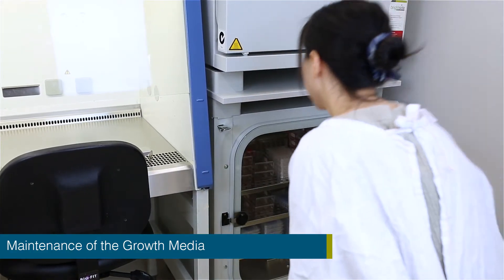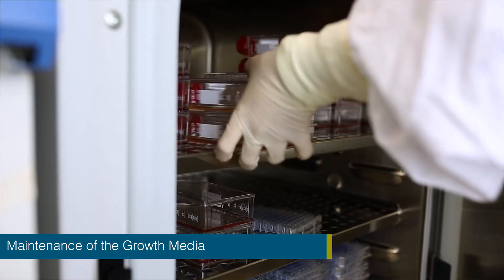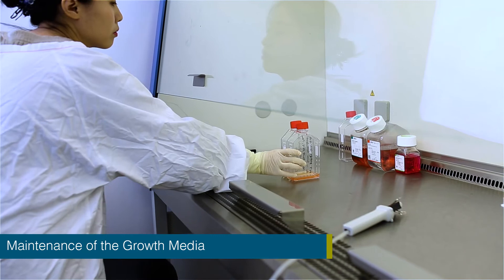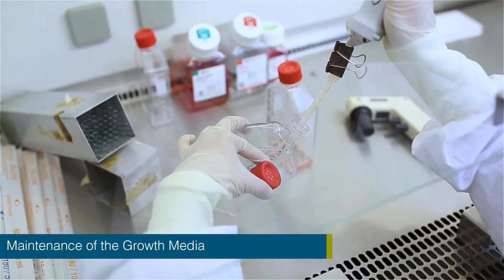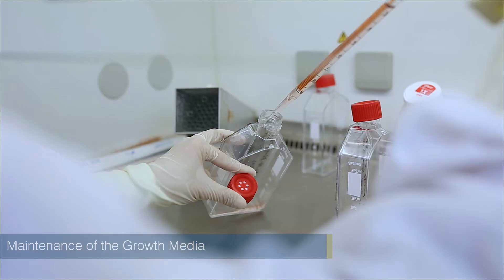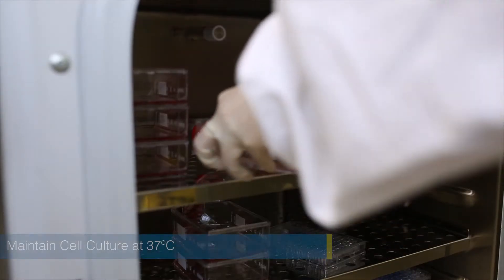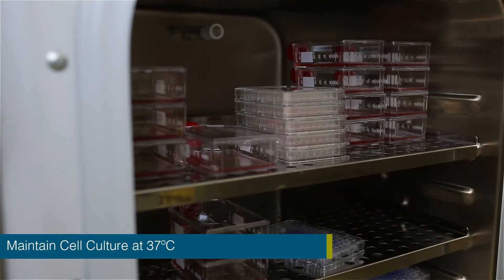The growth media, which has been preheated to 37 degrees, is removed from the water bath and placed into the biosafety cabinet. The growth media is aspirated from the cell culture flask and replaced with the fresh media. The cell culture flask is then placed back into a cell incubator and maintained at 37 degrees in humidified conditions.